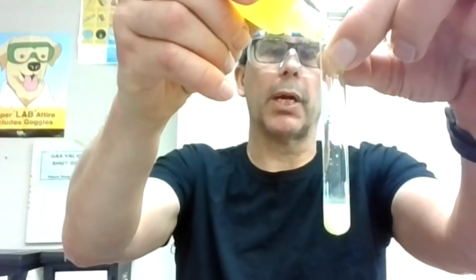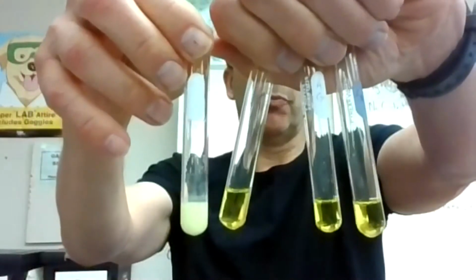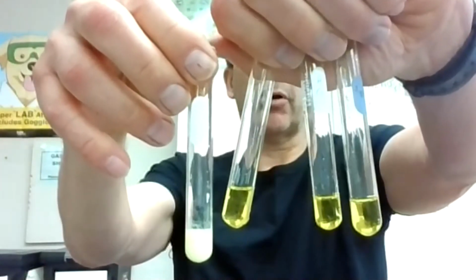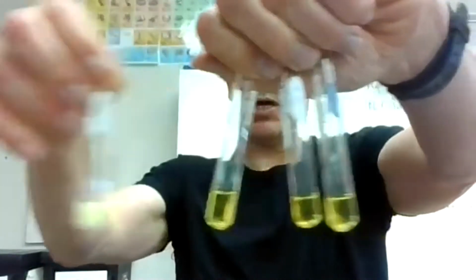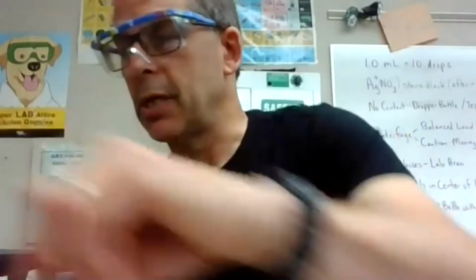And I think we had barium chromate in the last one here. So if I look at these 4 test tubes, I'm going to see 3 of them with no precipitate and the last one with a precipitate. So the 3 without a precipitate are right down the list: magnesium, calcium, and strontium, no precipitate. But the barium does precipitate with the chromate, forming this whitish yellow barium chromate. Okay, so only 1 precipitate reaction, and that was with the barium.